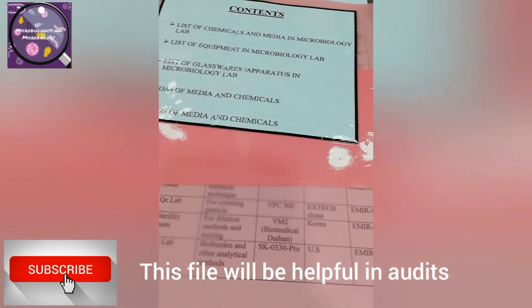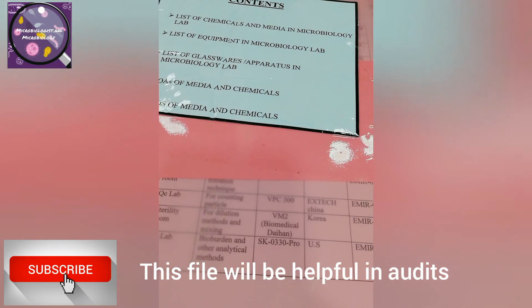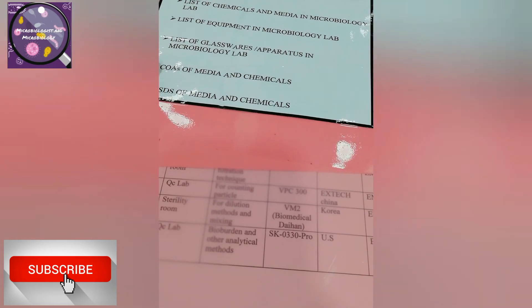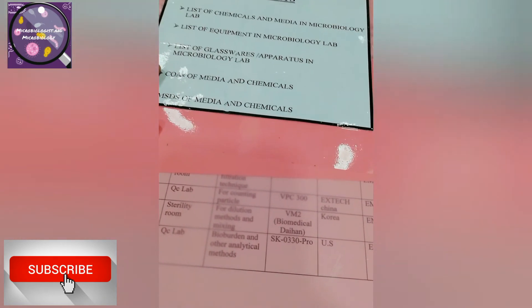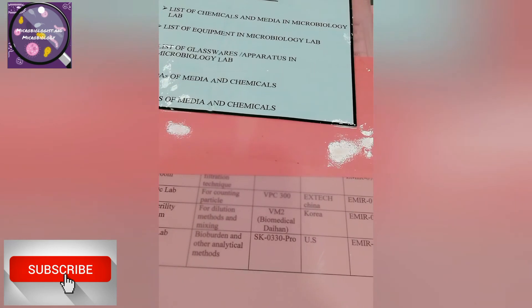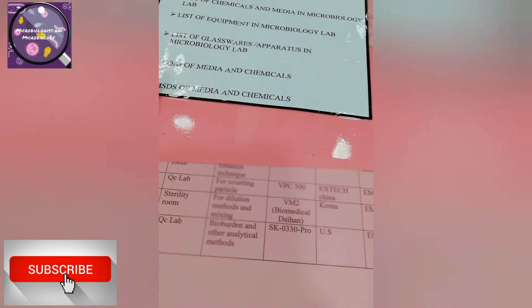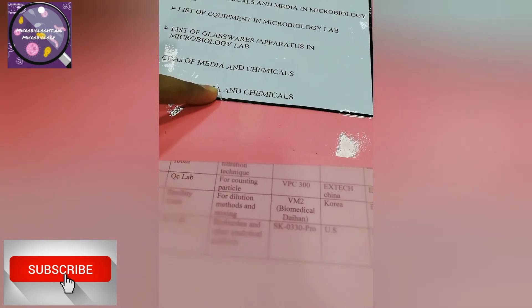Once we had an annual external audit and they asked us about the media and chemical certificates. We showed this file and they appreciated us for keeping everything updated related to good laboratory practices. GLP is concerned with maintenance of the lab — equipment, chemicals, documents, and the list goes on.